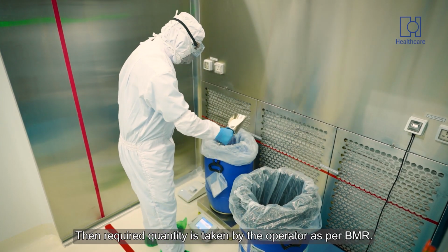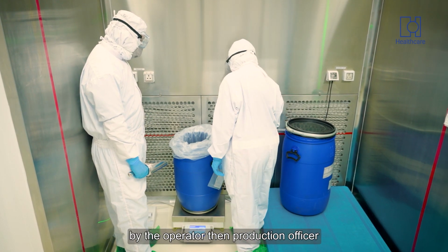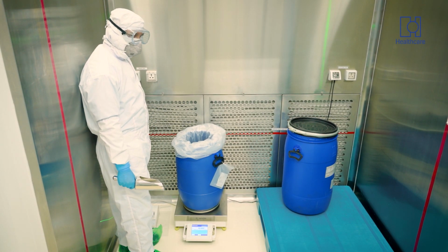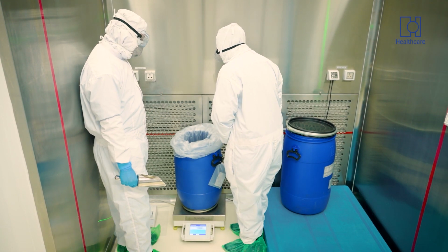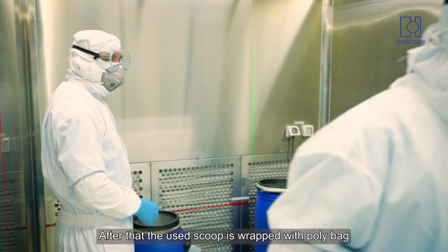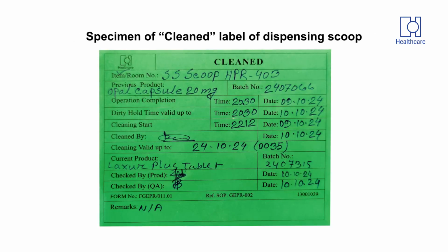Then the required quantity is taken by the operator as per BMR. Then the quantity is checked by the operator, then the production officer, and at last by the IPQA officer. After that, the used scoop is wrapped with polybag, attached to the clean label and kept in the used scoop container.